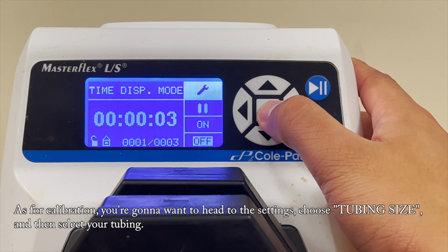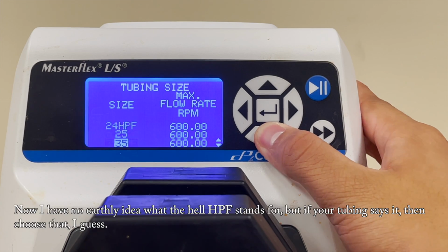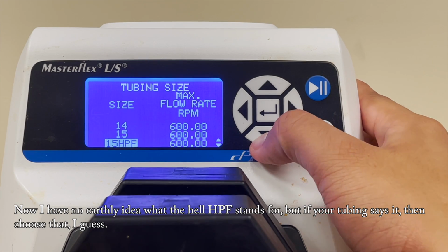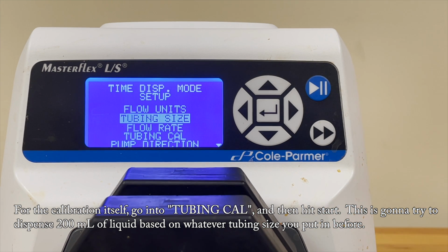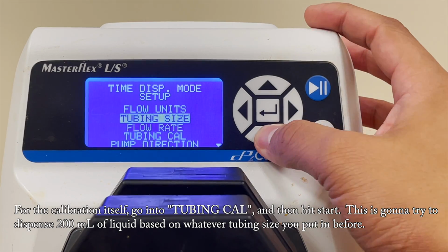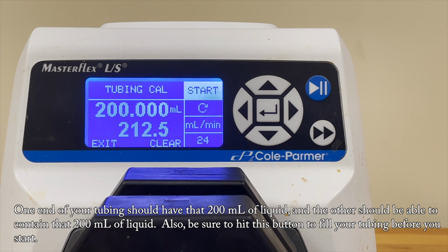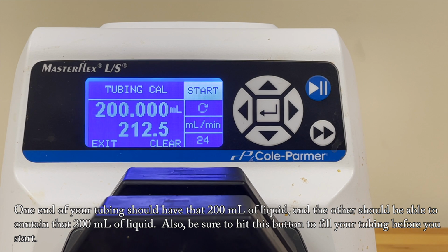As for calibration, you're going to want to head into settings, choose tubing size, and select your tubing. Now I have no idea what HPF stands for, but if your tubing says it, then choose that, I guess. For the calibration itself, go into tubing cal and then hit start. This is going to try to dispense 200 milliliters of liquid based on whatever tubing size you put in before. One end of your tubing should have that 200 milliliters of liquid and the other should be able to contain that 200 milliliters of liquid. Also, be sure to hit this button to fill your tubing before you start.